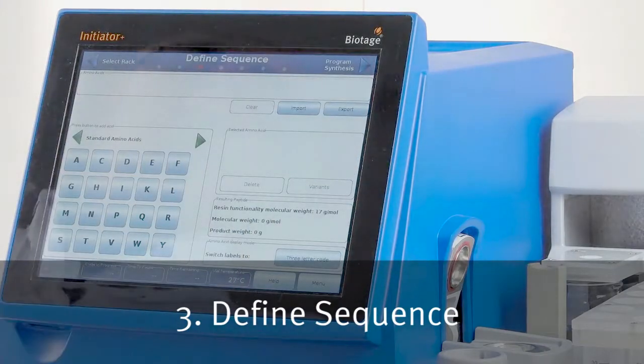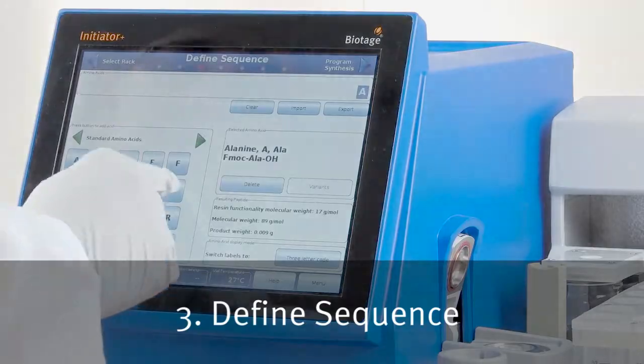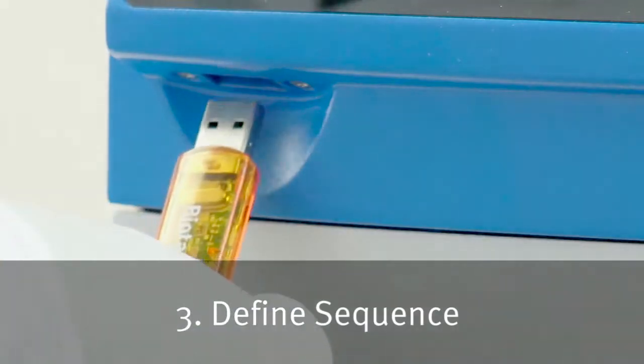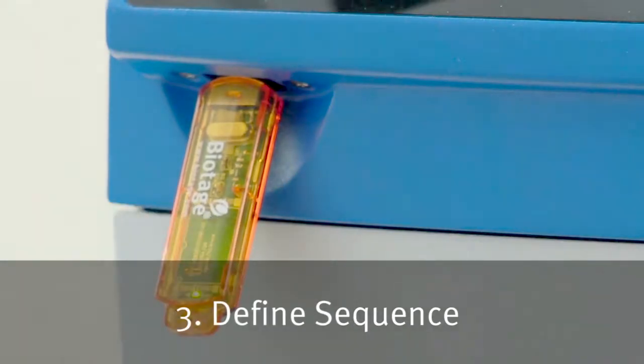Enter the peptide sequence, either as the one-letter code or three-letter code, or even import a sequence as a text file from a USB stick.